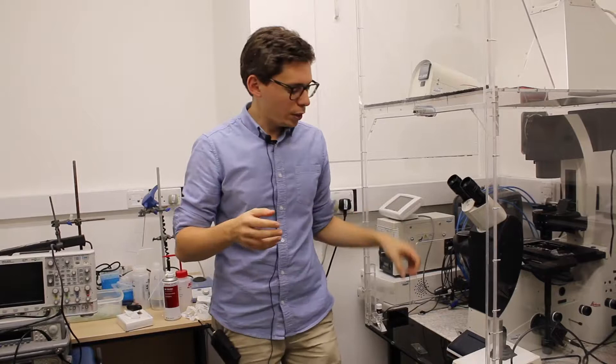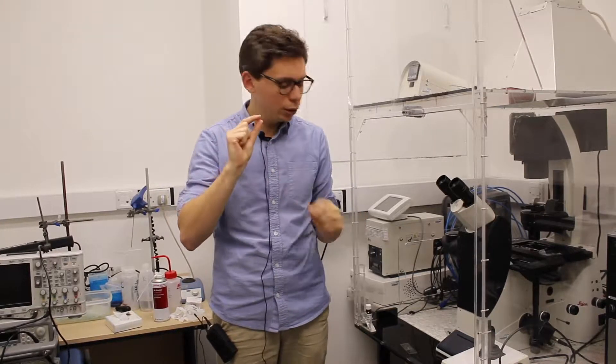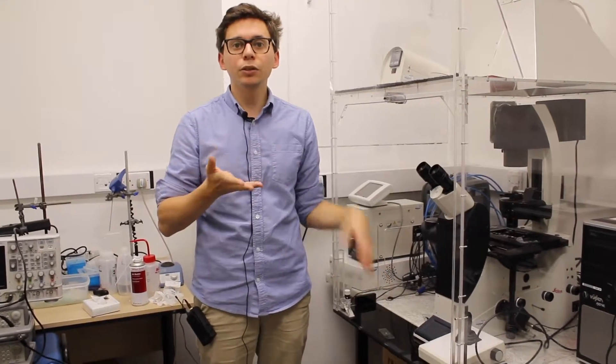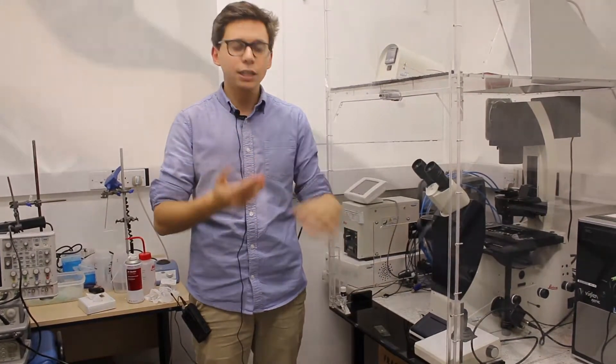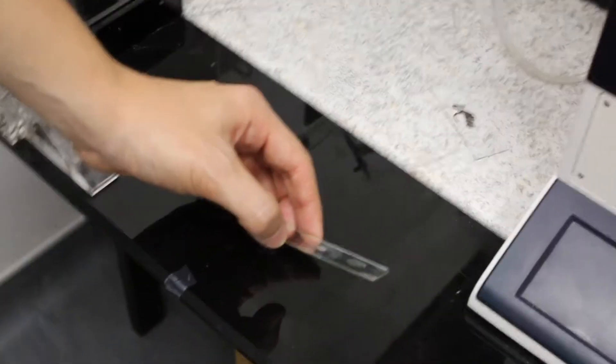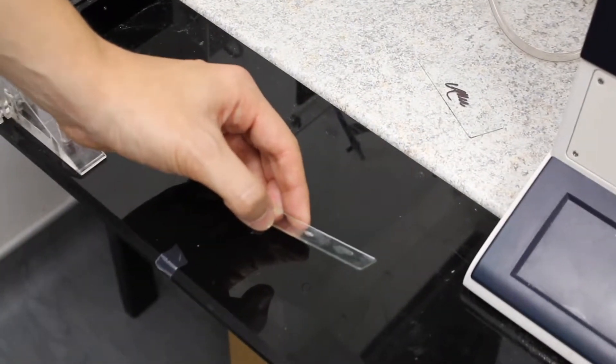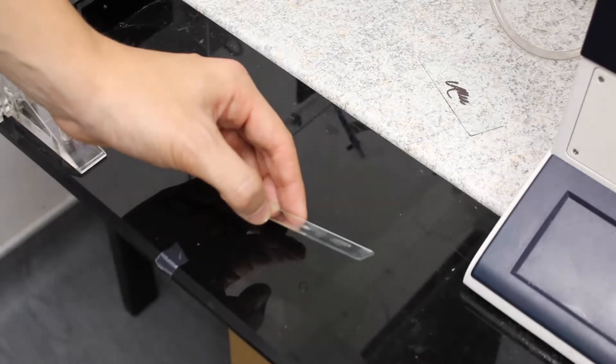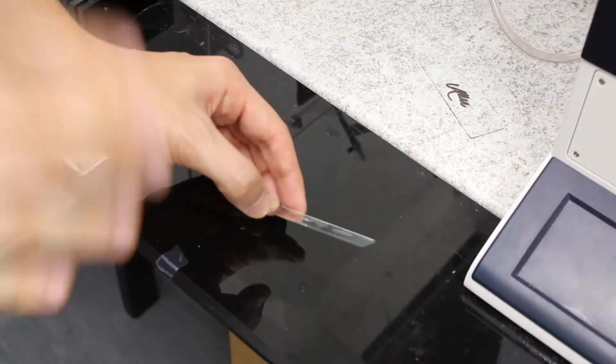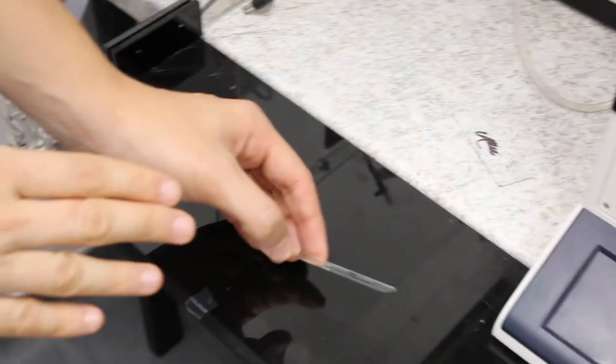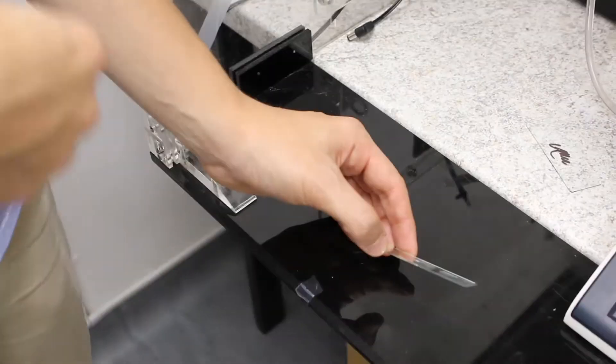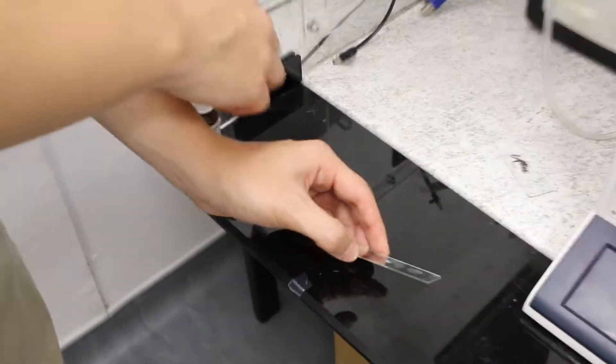I'll explain to you now how you use the oil immersion lens, the 63 and the 100. As I said, you will need to observe your sample through a coverslip and not a glass slide, because the working distance of this objective is very small. And you first need to put oil between your sample and the objective. So for that I would suggest not putting oil directly on the objective, but rather on the glass slide, because you will use less oil.